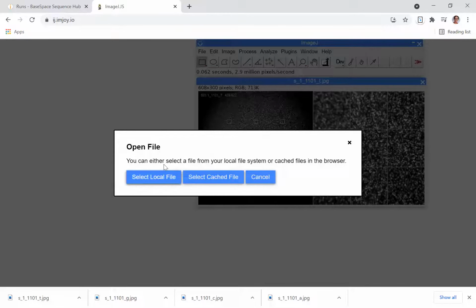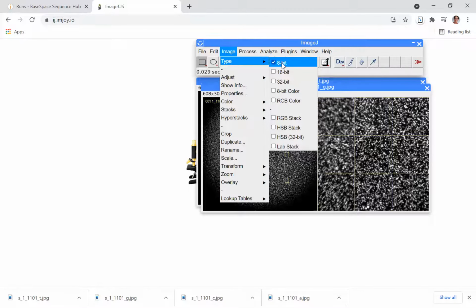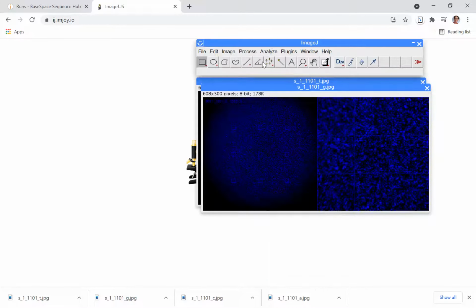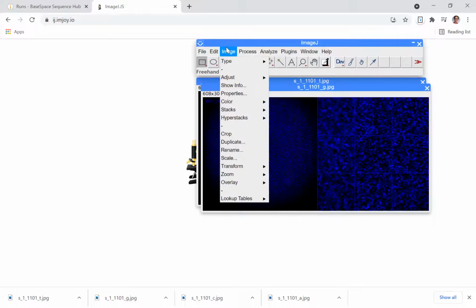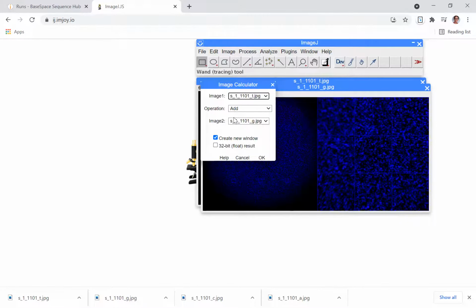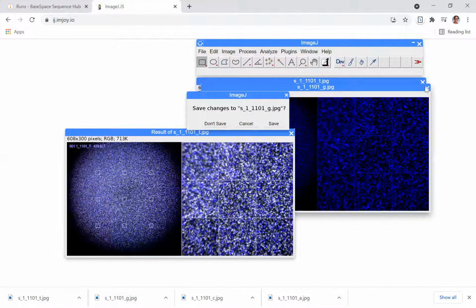So I'm going to open up the G image next. I'm going to convert it to 8-bit to get rid of those yellow lines, use a blue lookup table, since on all of the base space graphs, G is blue. And then I'm going to use Image Calculator under the Process menu to add the 2 images together. Before I do that, I have to make sure to change the G back to a color image. So I change it to 8-bit, use a blue lookup table, and then change it back to color. Now I can add the 2 images together. I'm going to add the T with the G, say OK. And now I have 2 of the colors for the sequencing run in one image.